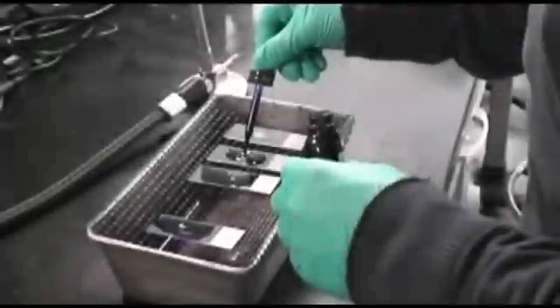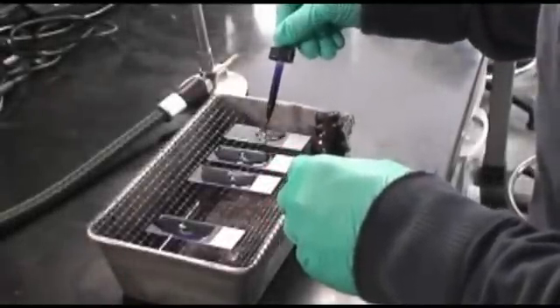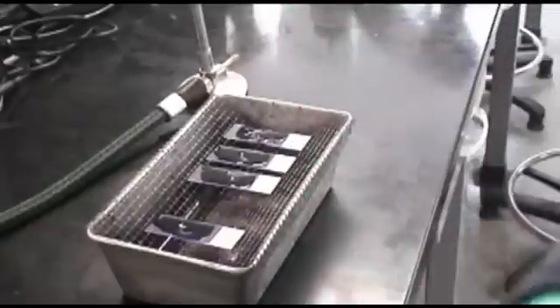The Gram Stain consists of a series of stains. First, cover the smears with crystal violet for 30 seconds. Gentle rocking of the slides will facilitate proper coverage.